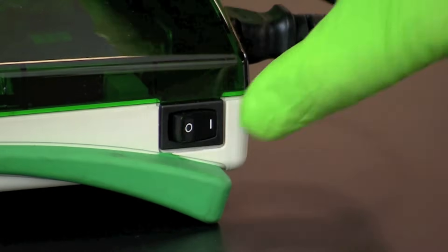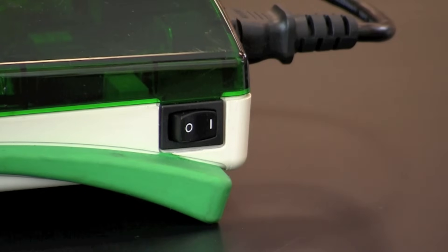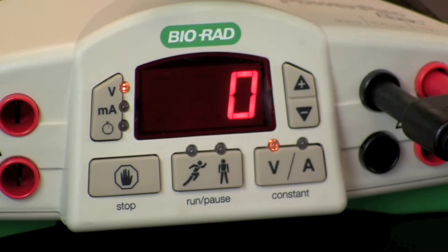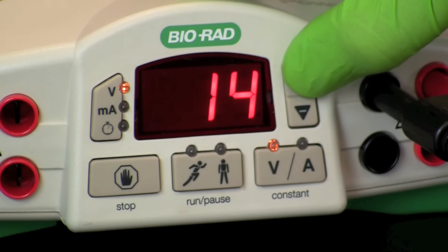Switch the power supply on, then set the correct constant voltage for running the samples. See your lab protocol for this information.